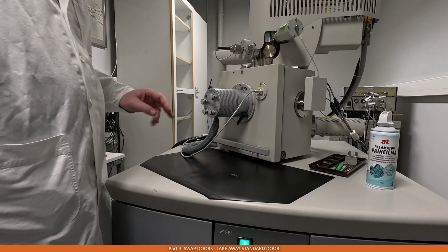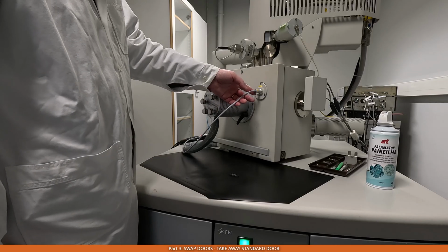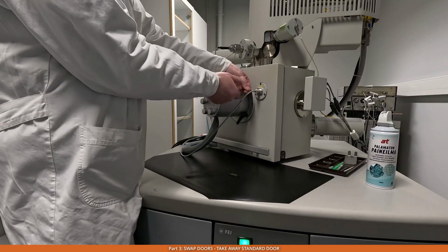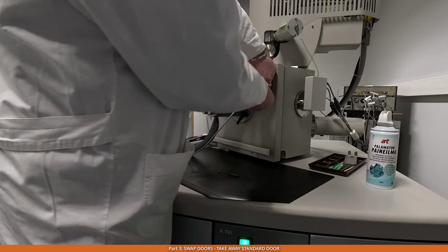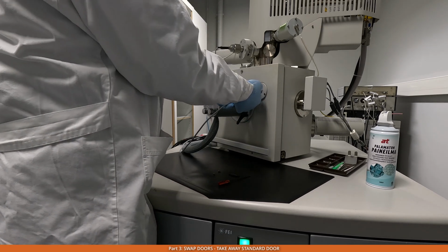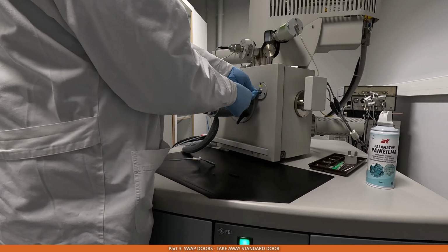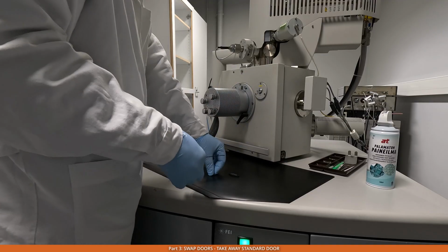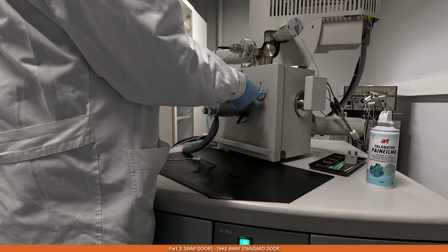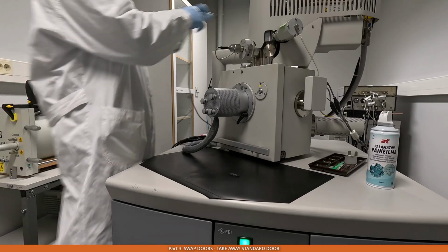And there are a few cables that actually need to be removed. The first one is the cable here on the right hand side, which is the stage bias cable. What we need to do is take away 2 screws on the side of it. So there's just a standard connector, which can be untightened and removed. And then we put back the screws to make sure that they're not lost. Then we can put the cable away.